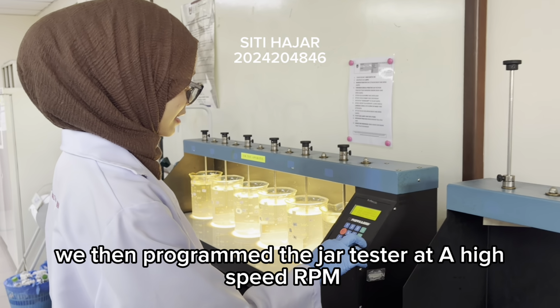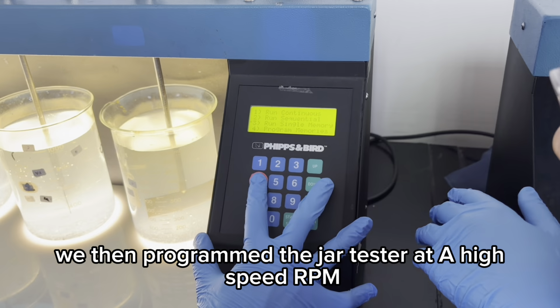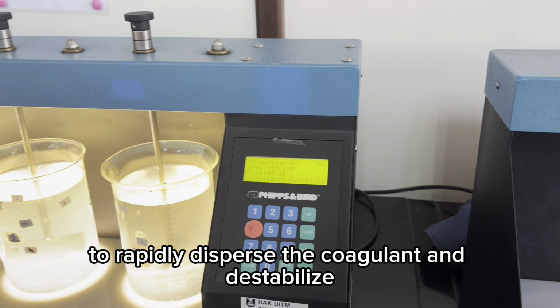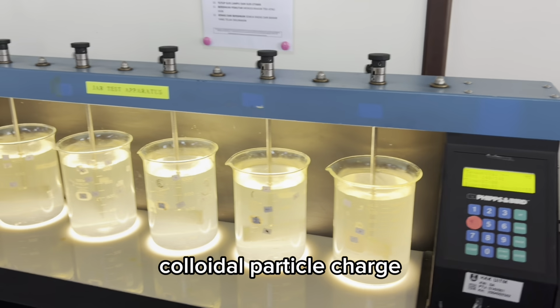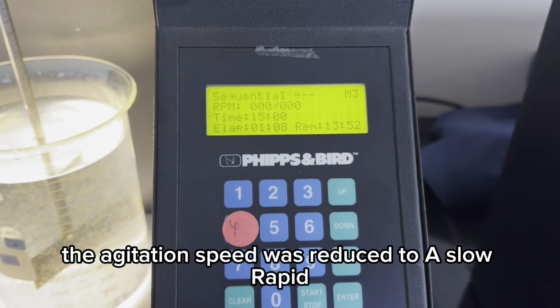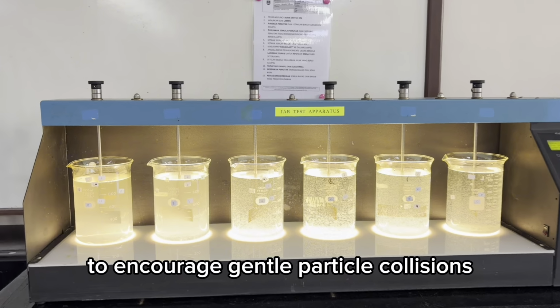We then program the jar tester at a high-speed RPM for a short duration to rapidly disperse the coagulant and destabilize colloidal particle charge. The agitation speed was then reduced to a slow rate to encourage gentle particle collisions.